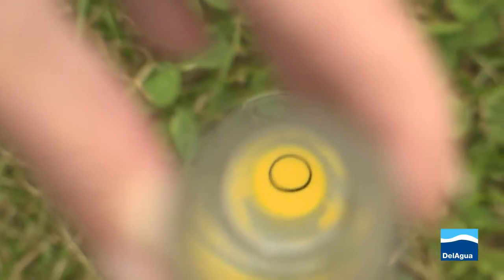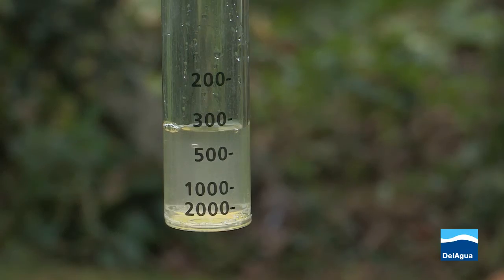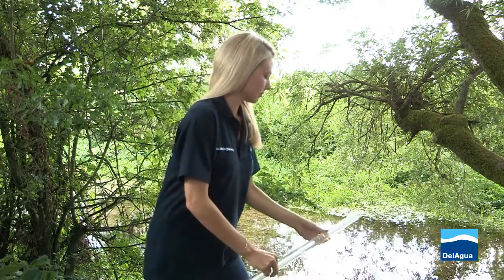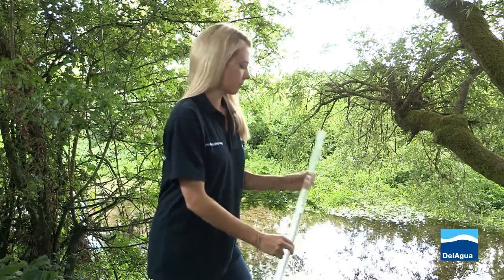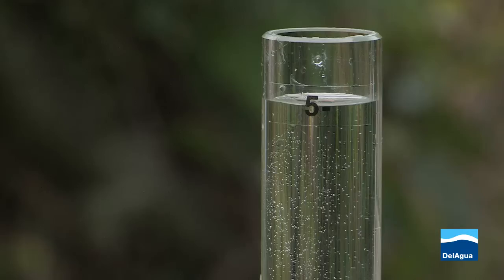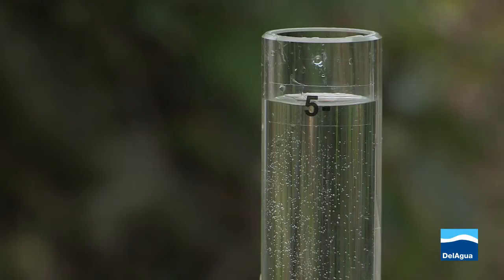Look down the tube to view the black circle. If the circle is visible, take the reading from the calibrated graduations on the side of the tube. If the circle is not visible, tip a small amount out of the tube and repeat the process. Continue this process until the circle is visible. Visibility of the circle in a full tube indicates a turbidity of less than 5 NTUs.